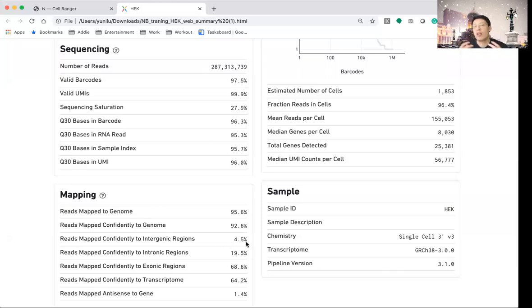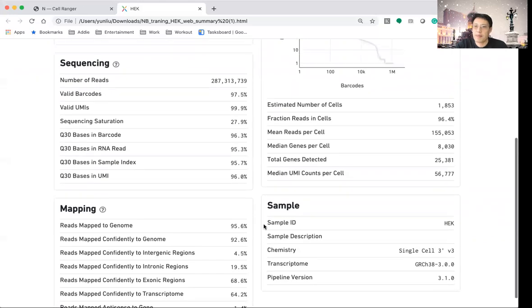If you look at this, you'll have very good confidence that you are sequencing the RNA molecule, because only a very small percentage goes outside of the gene regions, which is the intergenic regions. You'll also see about 19% or 20% that goes to the intronic regions, and most of the remainder goes to the exonic regions. Normally we will see about 20% of reads going to intronic regions. However, for nuclei sequencing, this number will go up a little bit, to somewhere around 35 to 40% of reads going to the intronic regions.